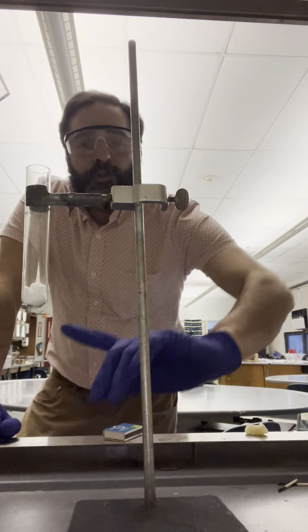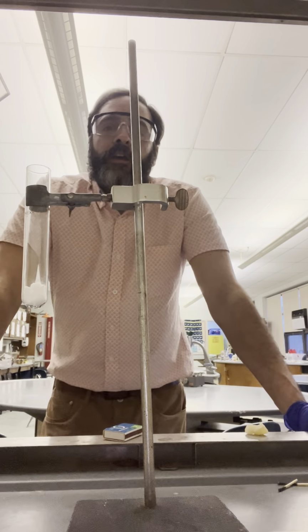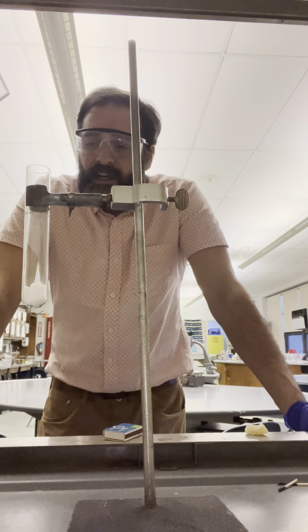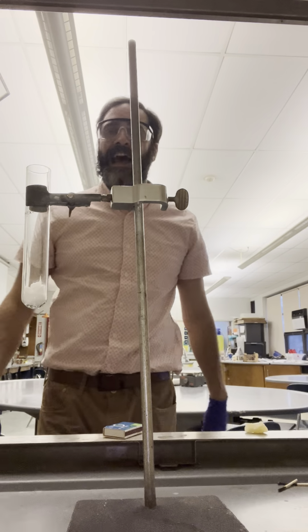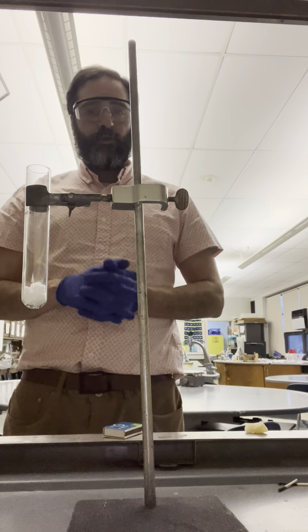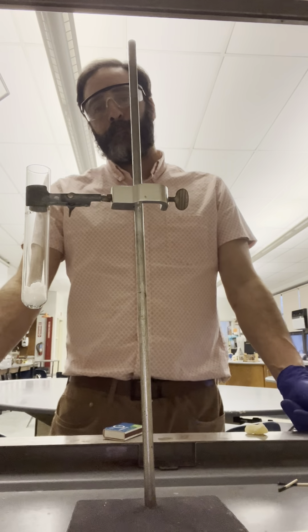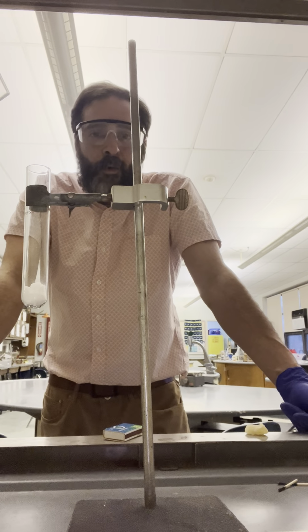All right, in the test tube, we have a chemical called potassium chlorate. That is KClO3. Because the chemical has oxygen in the polyatomic anion, this chemical can go through a decomposition reaction to release the oxygen, and the potassium chloride, the KCl, stays in the test tube. All we have to do to undergo this decomposition is heat it up with a Bunsen burner.